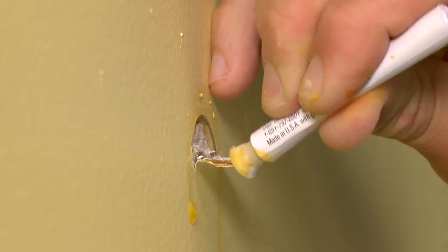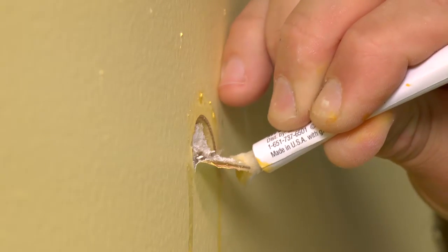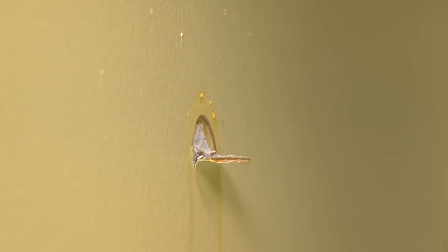Carefully rub the swab around the periphery of the peeled back flap, taking care not to contact the drywall or plaster. Only rub the swab on all layers of paint found on the flap. Do not rub the swab in the pocket.